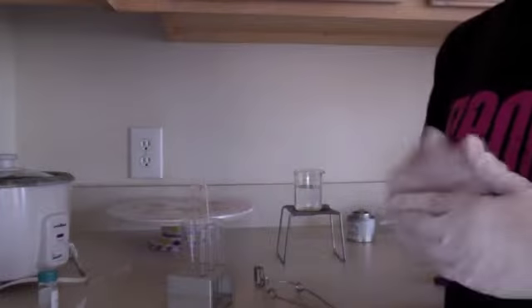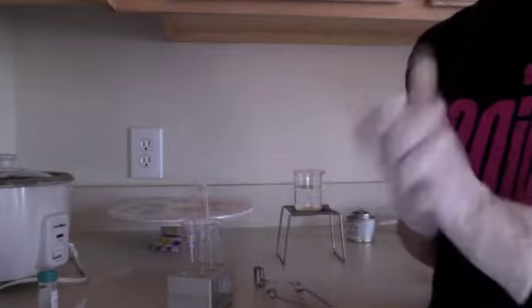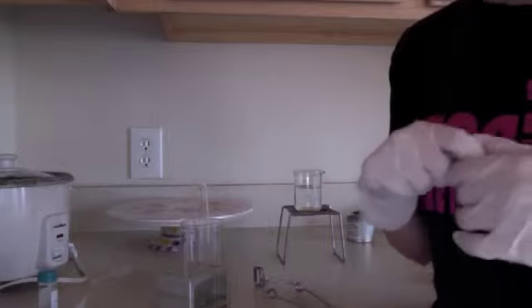Now we are going to do part 2 of the synthesis of Fragrant Esters Lab. Alright, so we've already labeled test tubes 4, 5, 6, and 7. I broke one of my test tubes, so we're going to make do with this bigger test tube. We've already placed them in a rack, and we are going to do the rest of the steps.